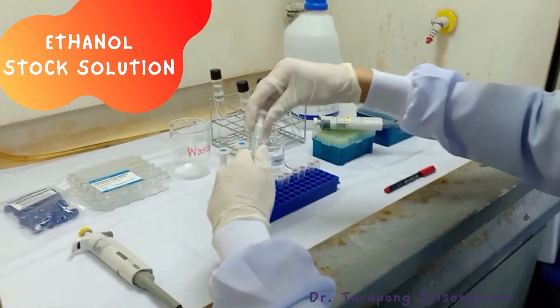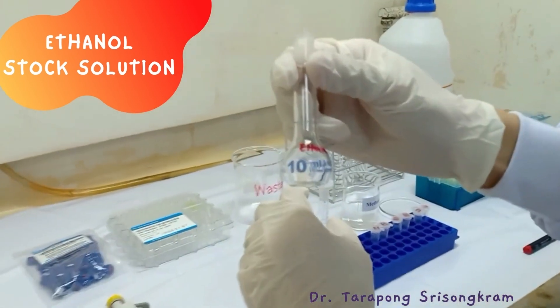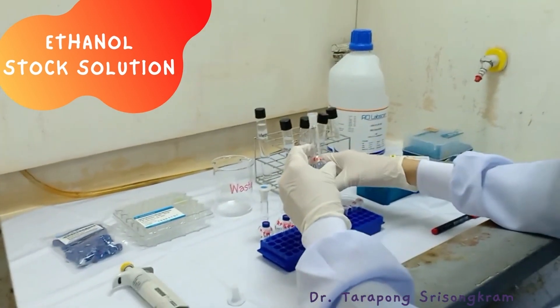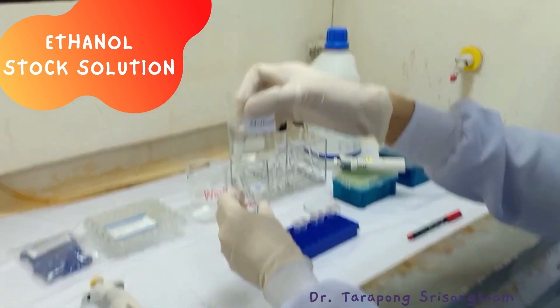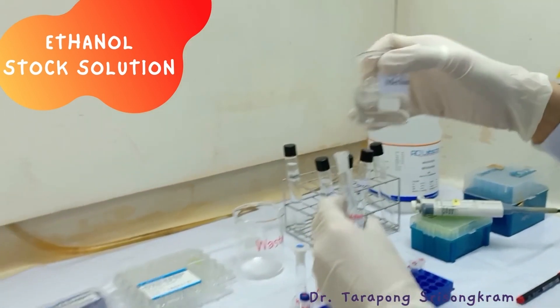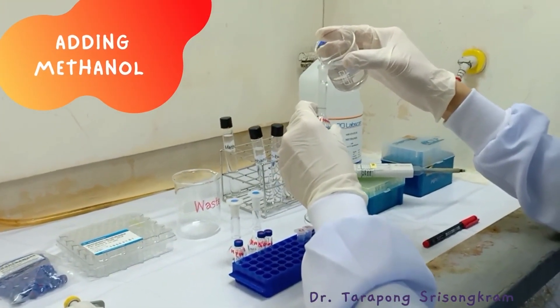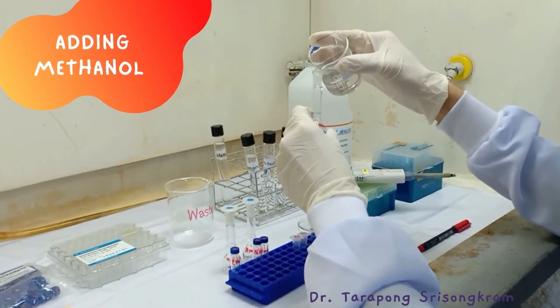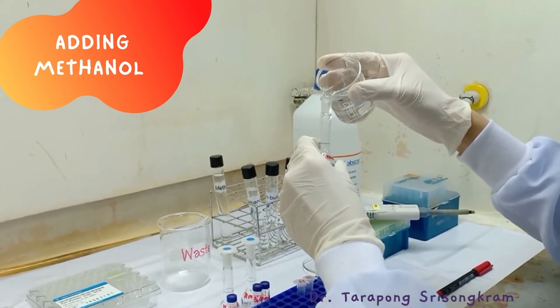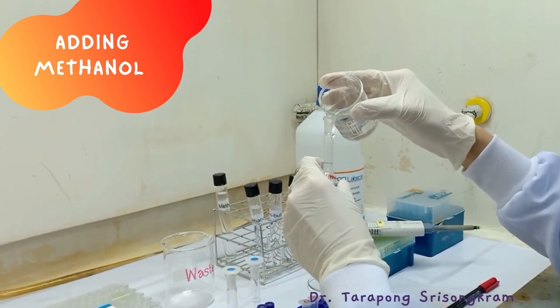This is an example of how to prepare an ethanol stock solution.